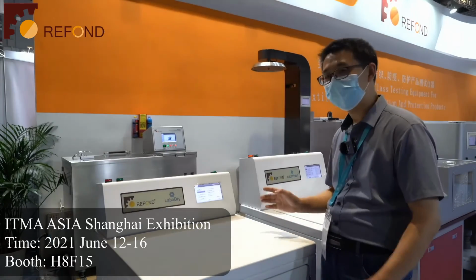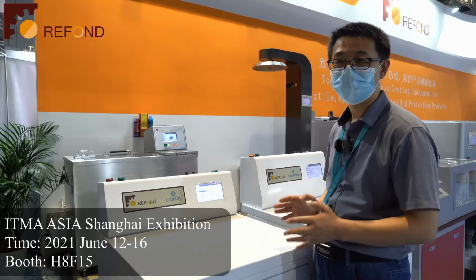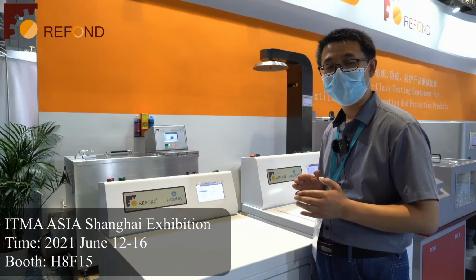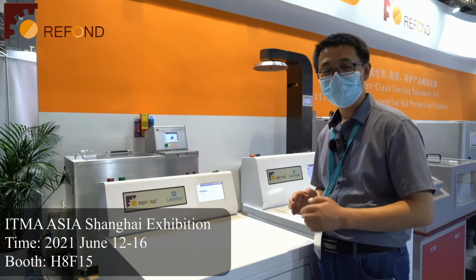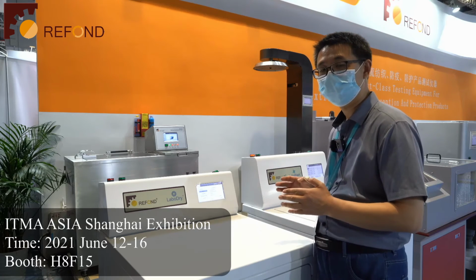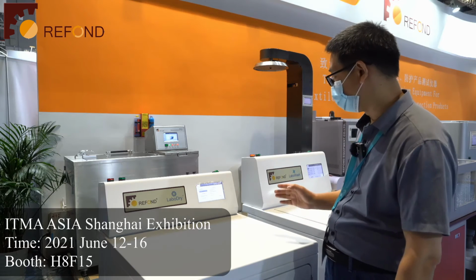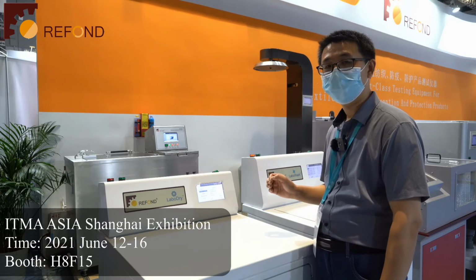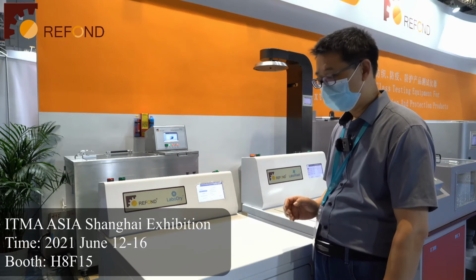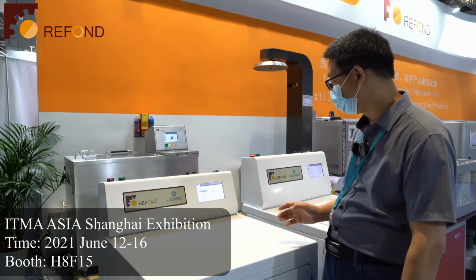As you know, if you set a fixed drying time for a certain fabric, you don't know whether the fabric has been less dry or over dry. So if you can set the humidity in the exhaust pipeline, you can monitor the humidity online, or at any time you can decide whether the fabric has been dry. So that's the new function.